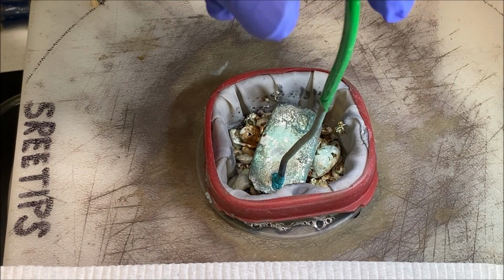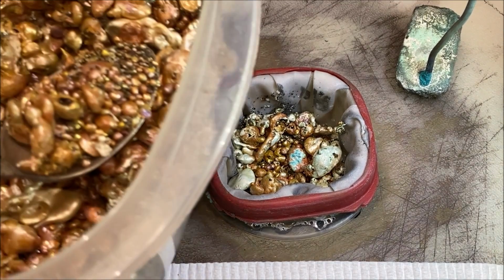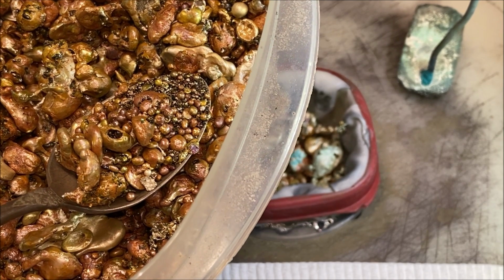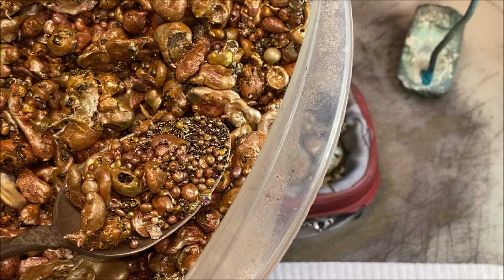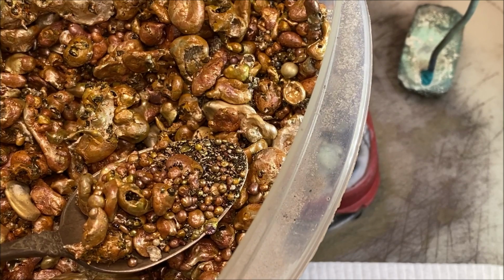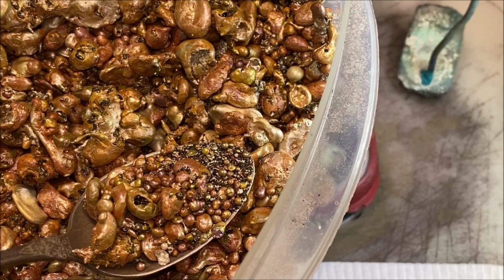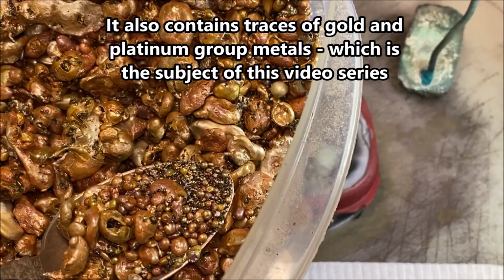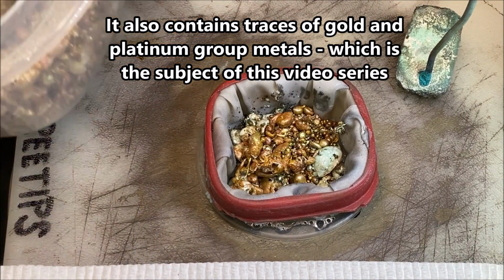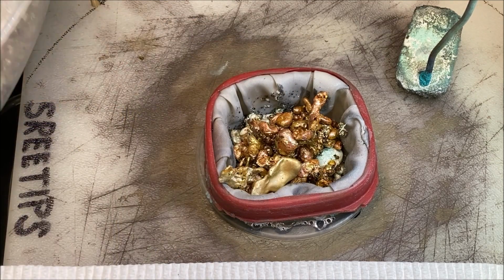Here's a shot looking down into the anode filter basket. What we're going to do is feed in some more impure silver shot. This has a golden color. Someone asked what the color is, and that's from the 1 to 2% copper composition of this impure silver, and that's what gives it that color. So we're going to add some more impure silver shot into the anode filter now, get this thing topped off.